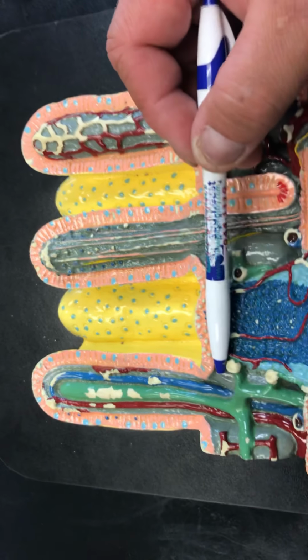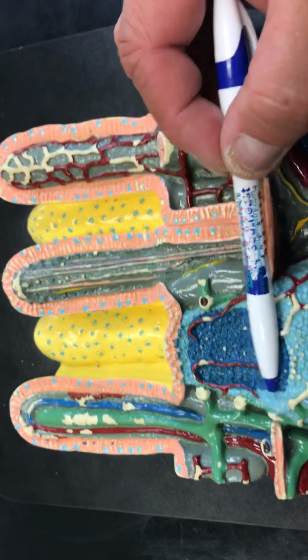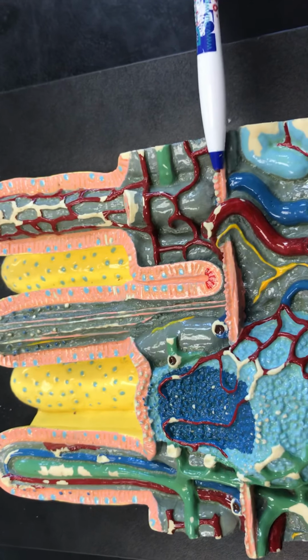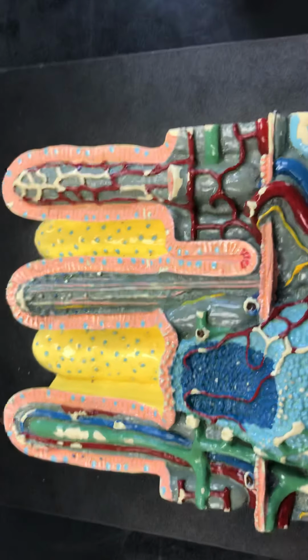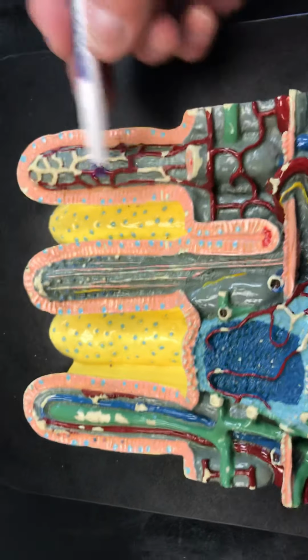Now, the deepest part of the mucosa, to go deeper here, is this muscularis mucosa. Unlike the muscularis externa, this muscularis mucosa layer is not important for movement or mixing. It's important for allowing the plica circularis to be fully intact. It doesn't allow it to tent up and then move down, like we see in the rugae.